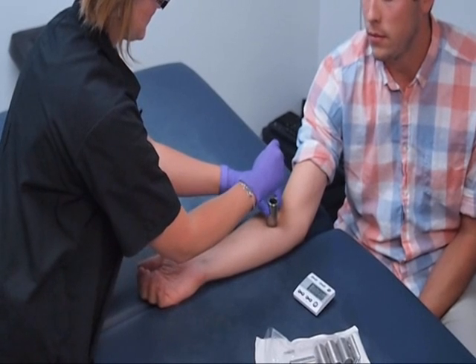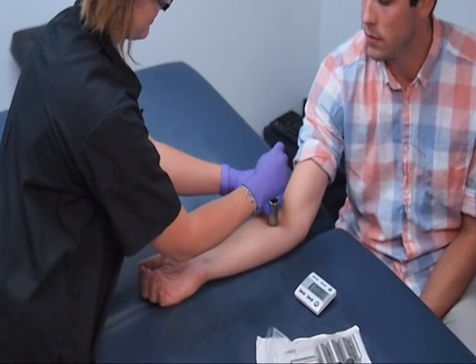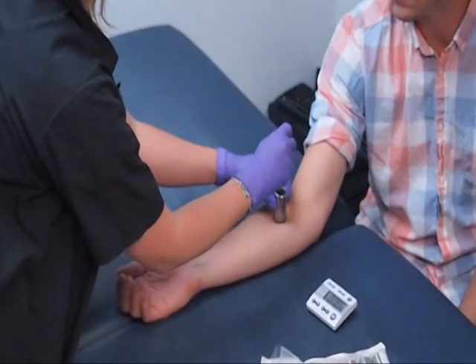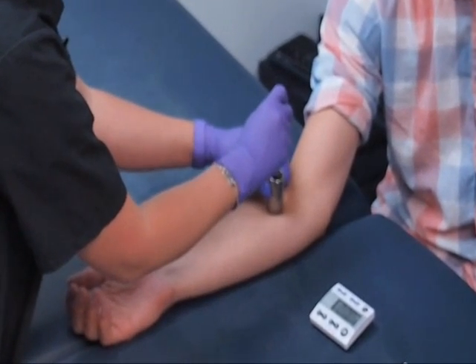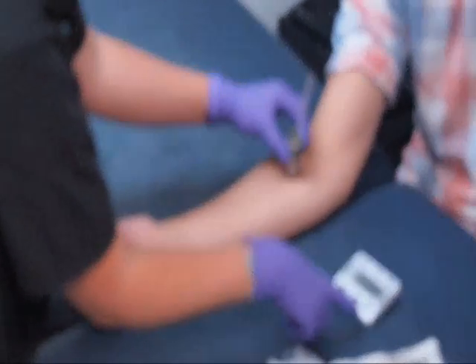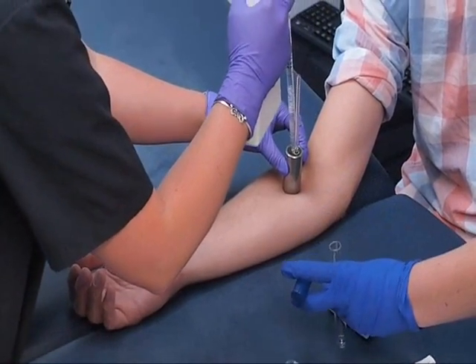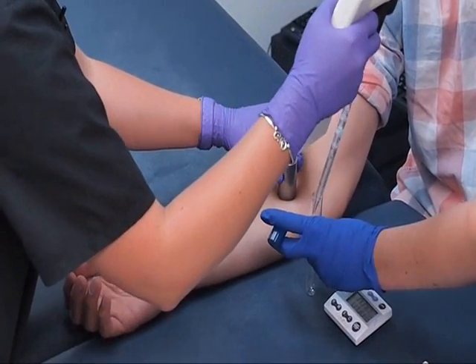The skin area within the cylinder is massaged in a sweeping motion for one minute using a sterile rubber policeman. The massage removes the microorganisms on the surface of the skin so that they are mixed with the solution. The sample is removed from the cylinder using a sterile pipette and placed into a sterile test tube.